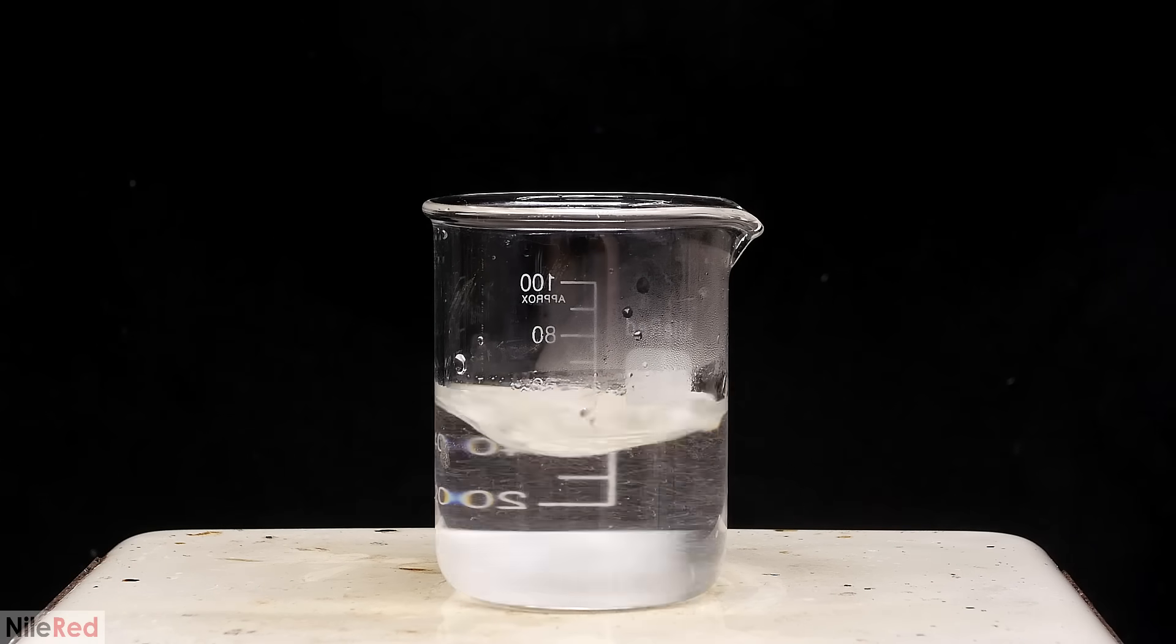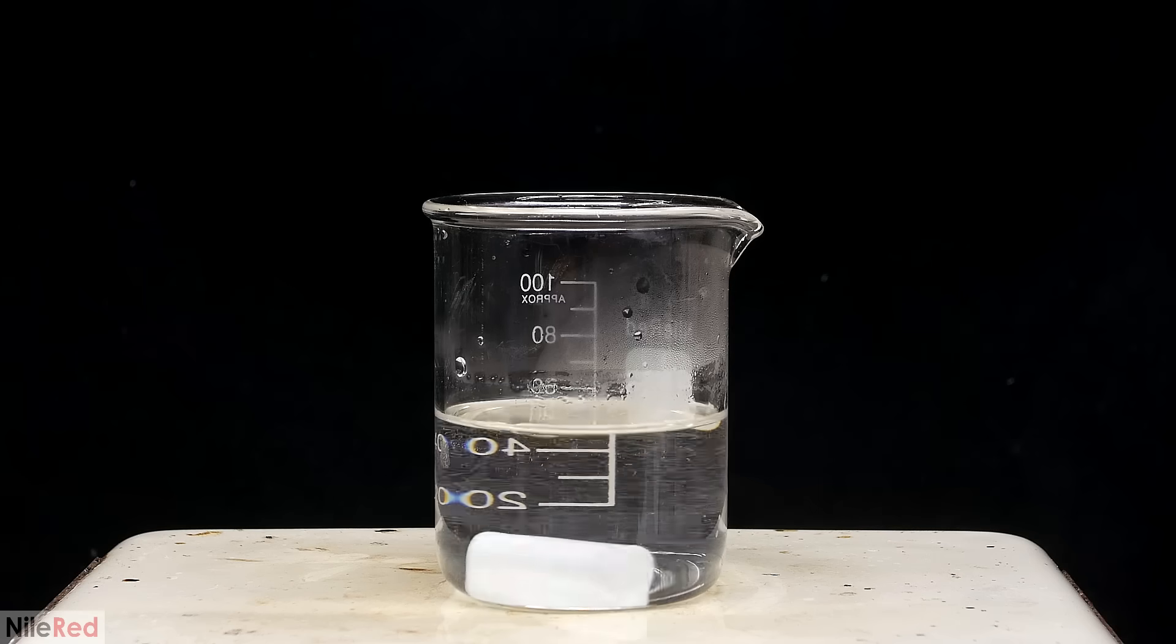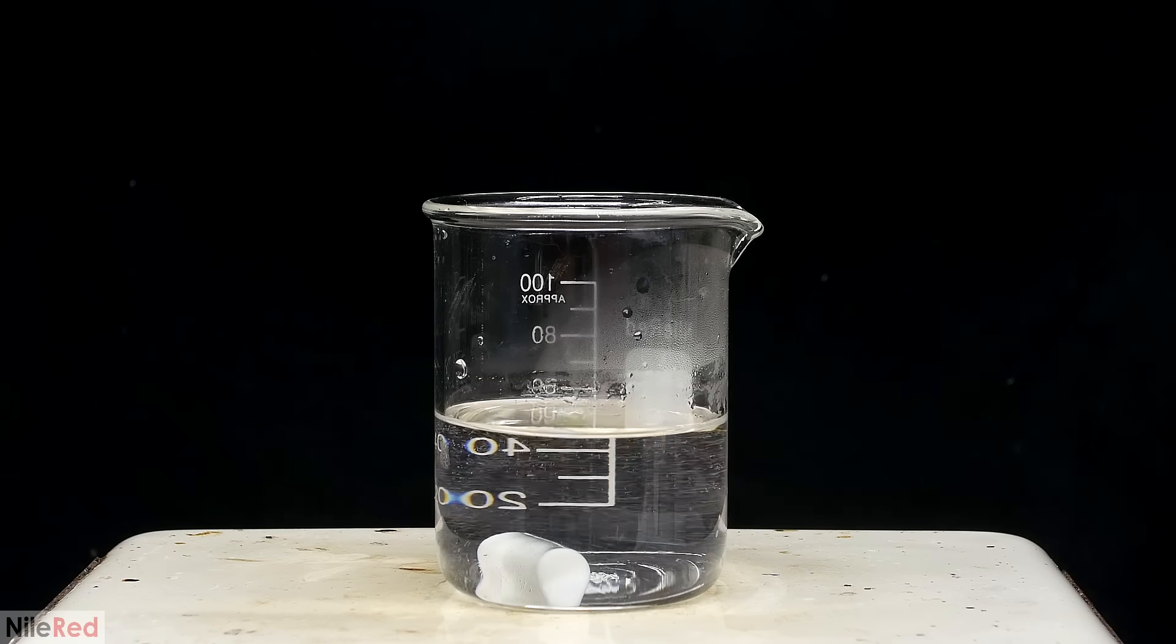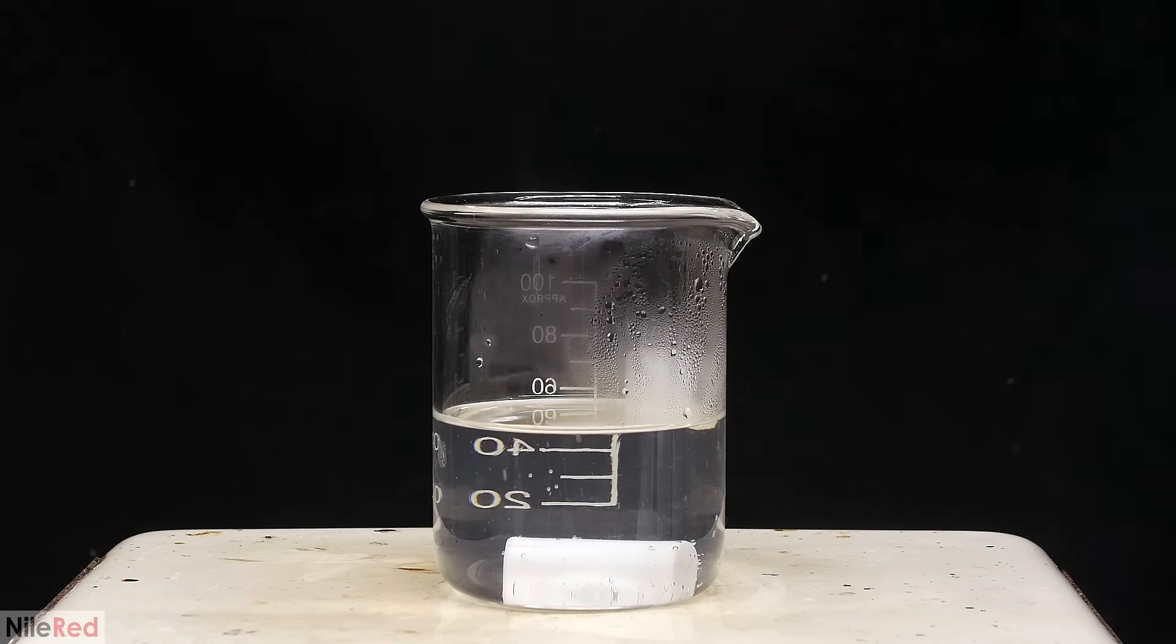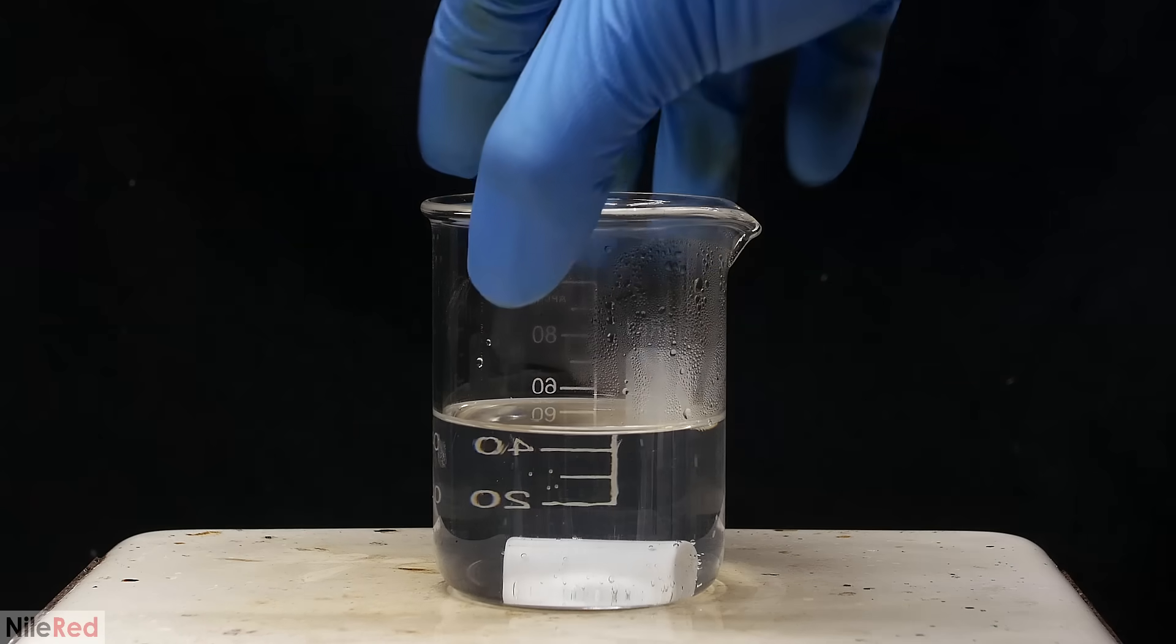I ended up adding a little bit too much water, so I had to add a bit more ethanol to redissolve everything. Eventually, I got to what I felt was a decent balance between the ethanol and the water, so I took it off the hot plate.